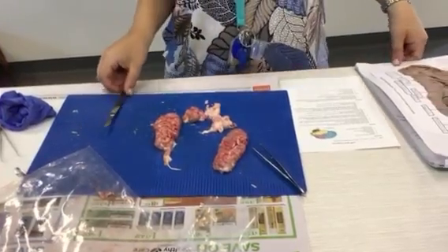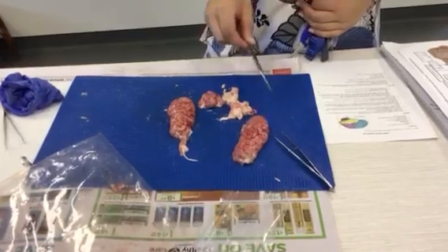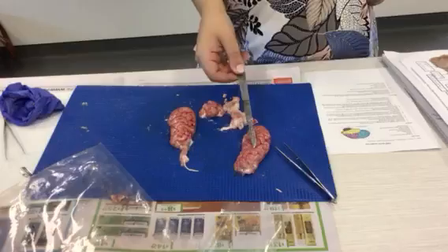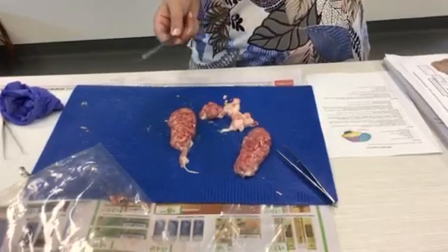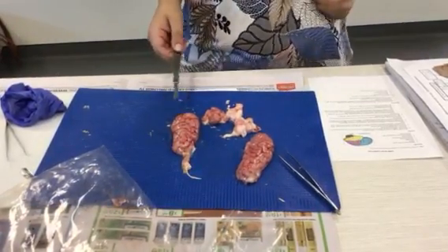Out, we discussed the fact that this main part of the brain is called the cerebrum. It is split into two hemispheres, and you can see that it's got these little lines which are called fissures. These fissures give the brain more surface area, which allows the brain to receive more oxygen from the blood, which allows it to operate well.